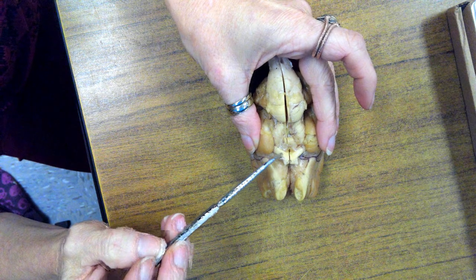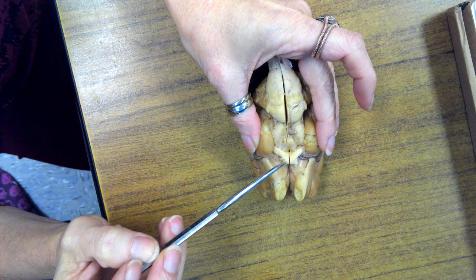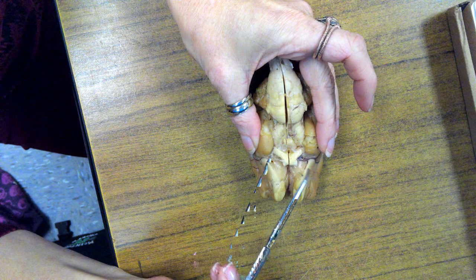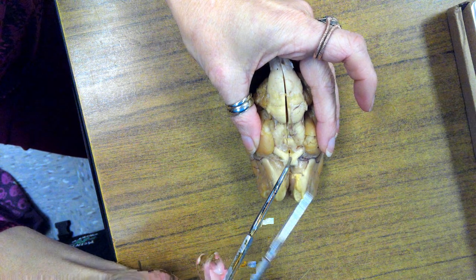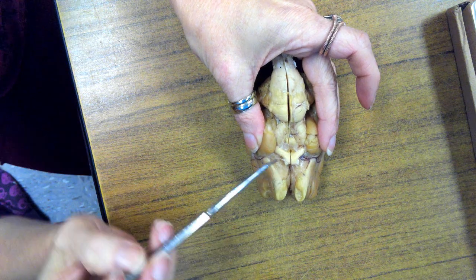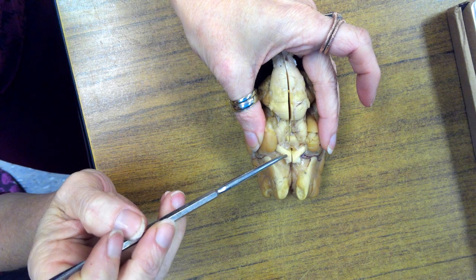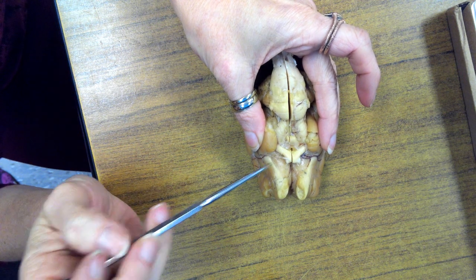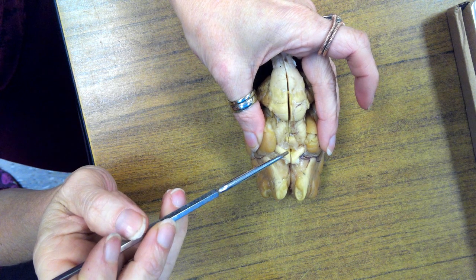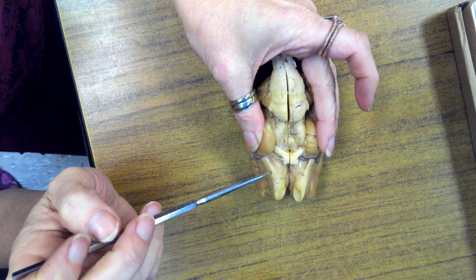This is the optic tract on both sides, and where it crisscrosses here, it's called the optic chiasma. Each one of these would go all the way to an eye, or to the other eye. Directly inferior to the optic chiasma is a little hole. That hole used to have a stalk, called the infundibulum. The infundibulum held on the pituitary gland.